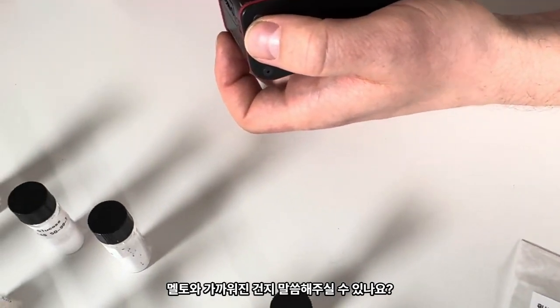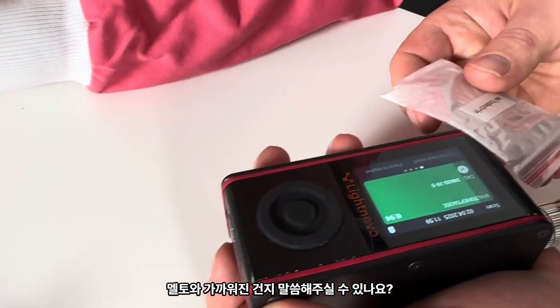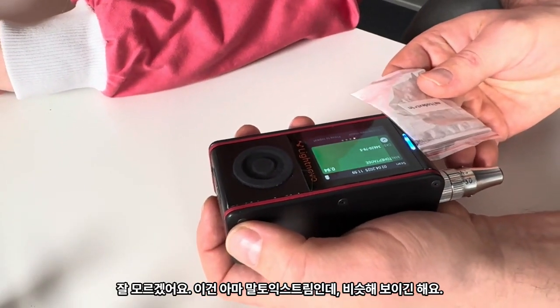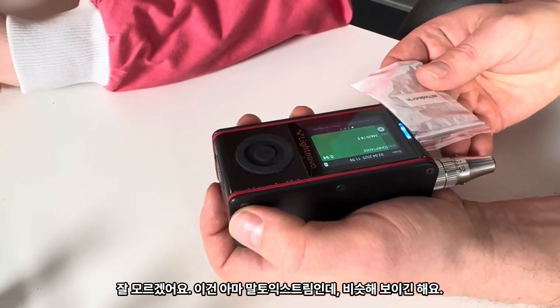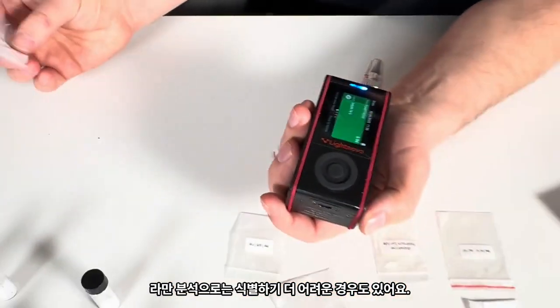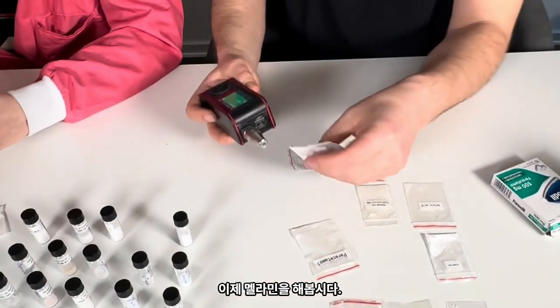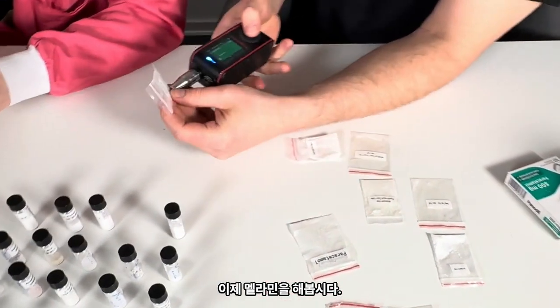As an expert, could you tell us, are we close to identification of this? Maltoheptaose? I have no idea. And this is maltodextrin. I think it's close. Good, you know, this is more challenging for the Raman to identify. Maltoheptaose. Okay, melamine.